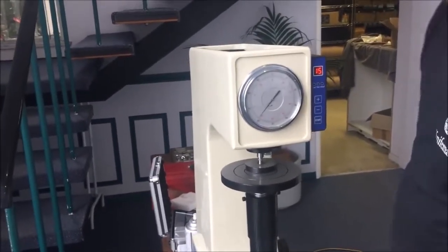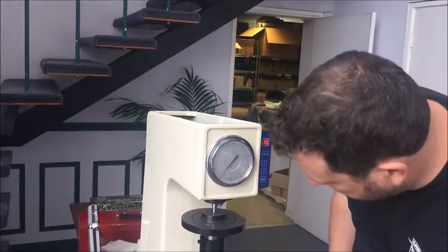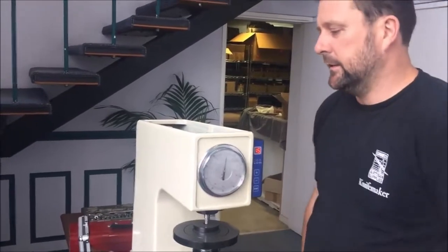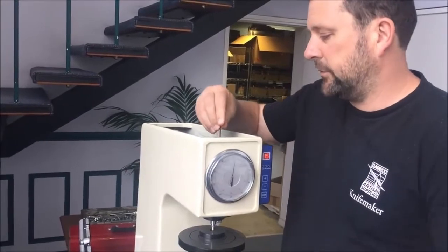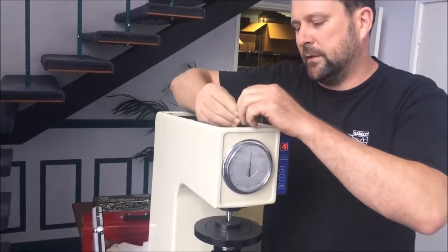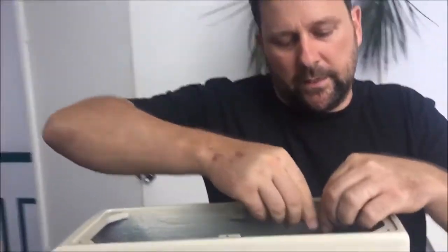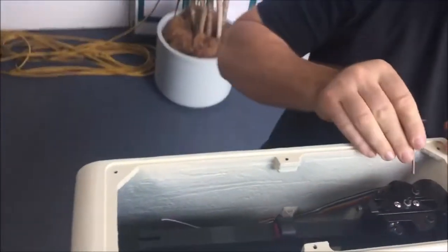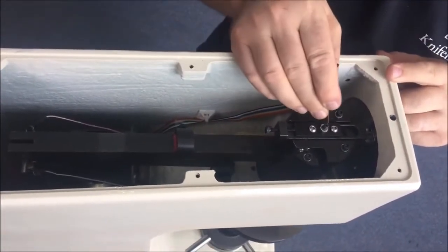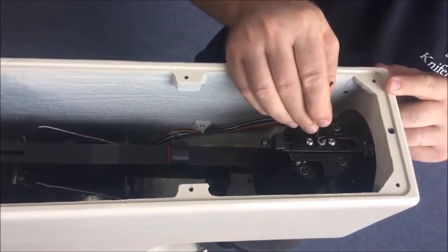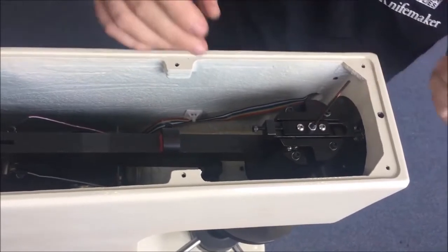However, yours may not read 61.5, and that's where calibrating your machine comes into play. One thing I don't like doing is destroying the calibration on a machine that's calibrated, but let's just do that. In the top of the machine we've got two locking screws, an adjustment screw, and we've got this one here which has got a grub screw with a lock nut on it.